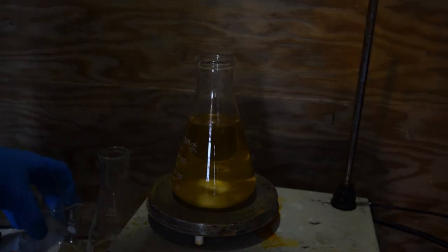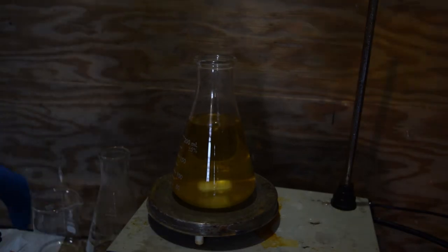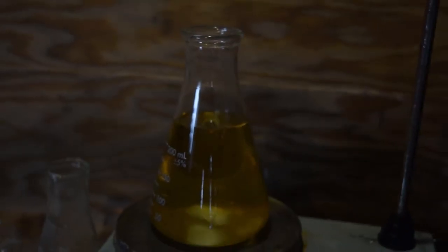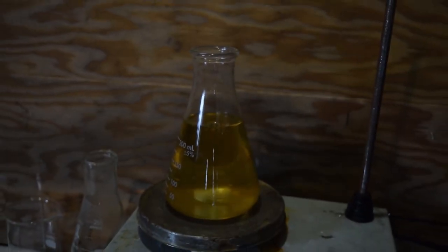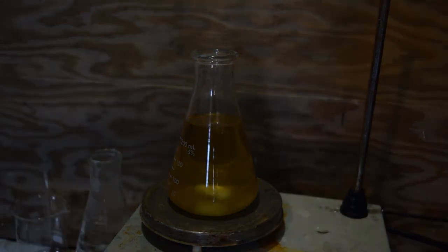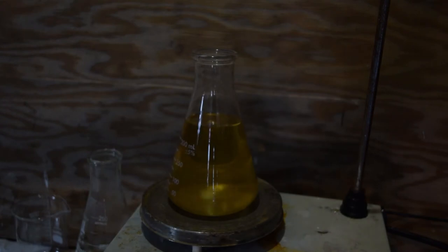All right, we're ready to go now. So that's going to start reacting but very slowly. We're going to have to heat it up to really get that reaction going and get the compound that we want, the phenyl isonitrile, to start to be able to smell it.